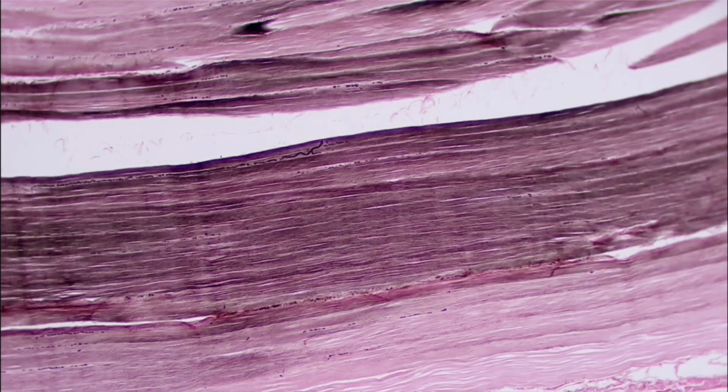Next, we're going to look at skeletal muscle, and this is a bit farther away. You might see it like this, or you might see it this close up. So we can tell that we have our really, really dark striations, and there are some areas of the slide that are lighter, some areas that are darker, but we don't see those really pronounced dark intercalated discs. They don't really exist in skeletal muscle, right?